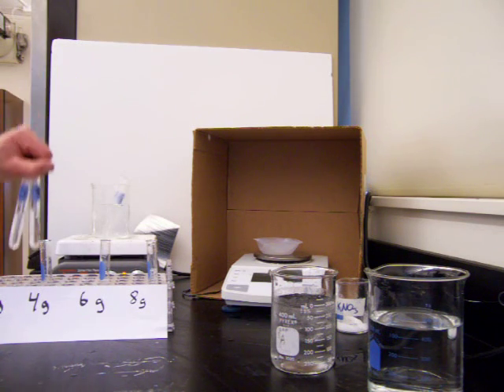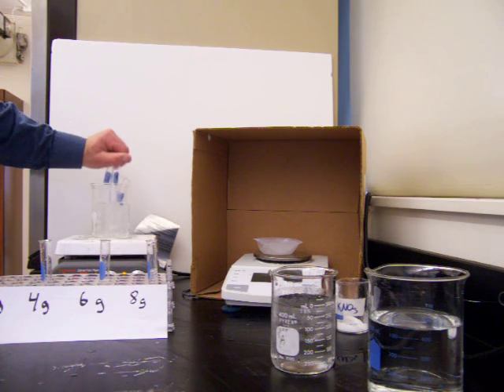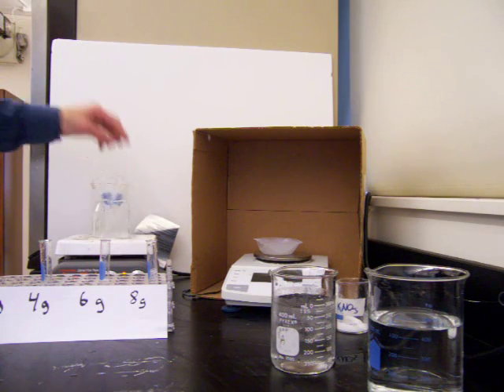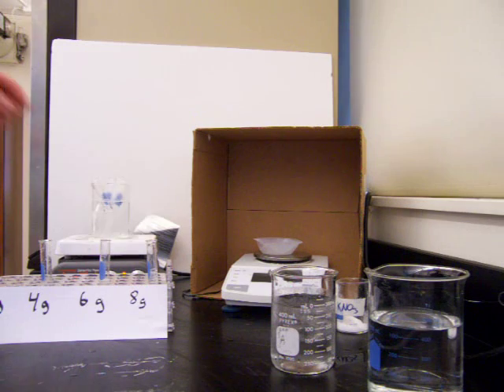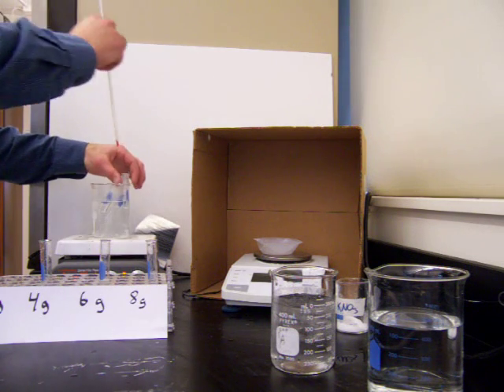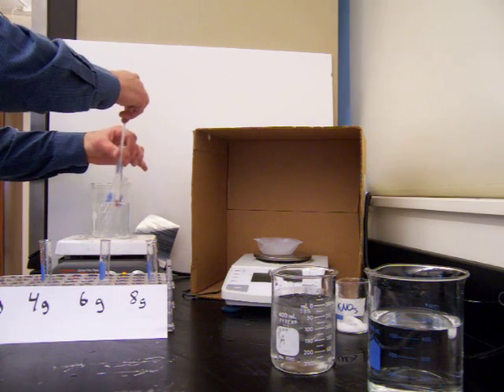I'm going to take the test tubes, I already have some set up from earlier, and put them into a hot water bath. In the hot water bath, we're going to stir these solutions until the salts have completely dissolved.